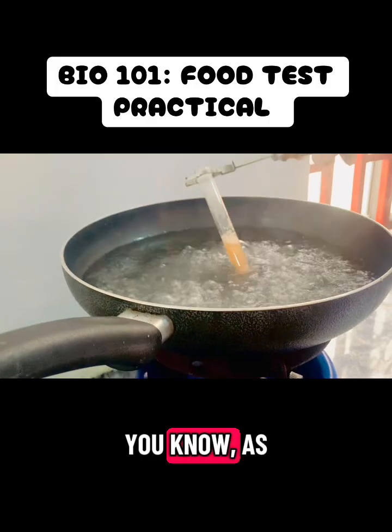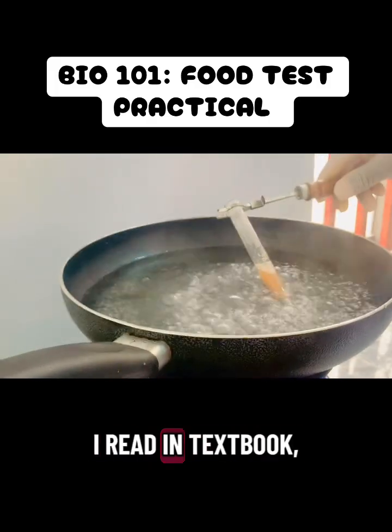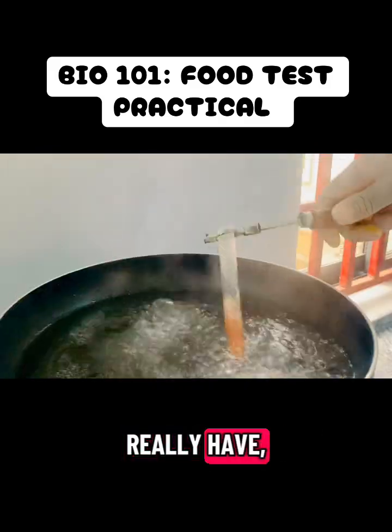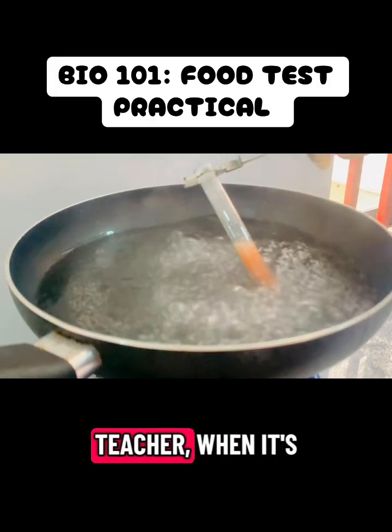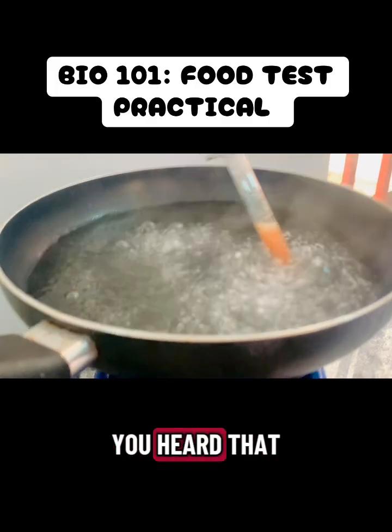Keep heating. As a biologist, there are some things that when I read in textbooks, I'm like, I need to see this practical happen in real life. Back in the days, I didn't really have so many opportunities to try out what I read in my textbook. But being a teacher, when it's time for practical, I'm even more excited than my students. Yep, you heard that right.